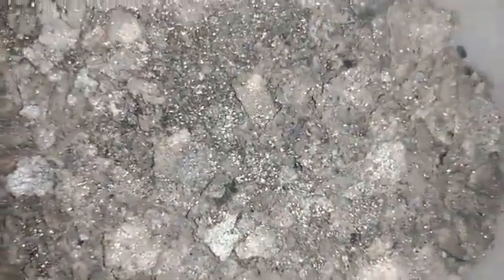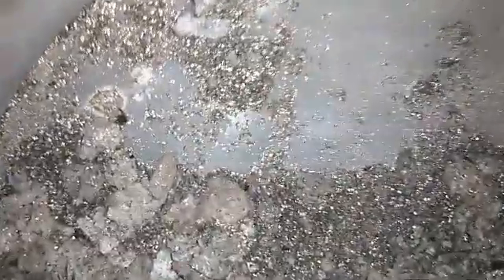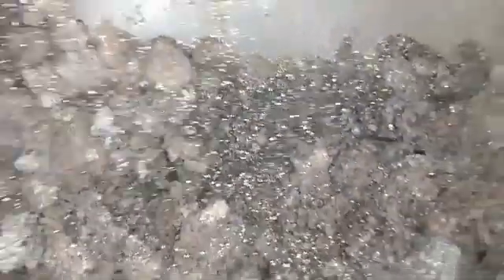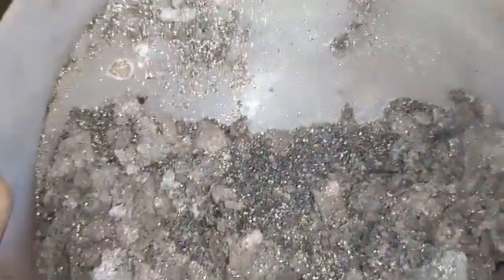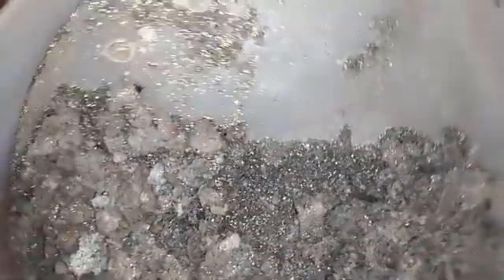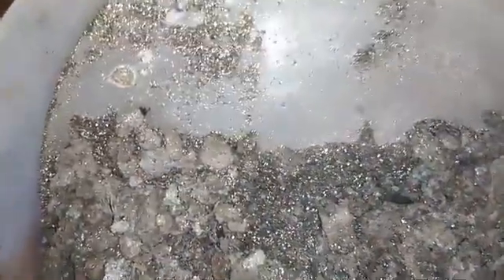We got some materials similar like asbestos here — you see that? All white silver flakes. My first opinion was that maybe it's some kind of noble metal, but because of the amount, maybe because you have a lot of these flakes, maybe it's some alloy.